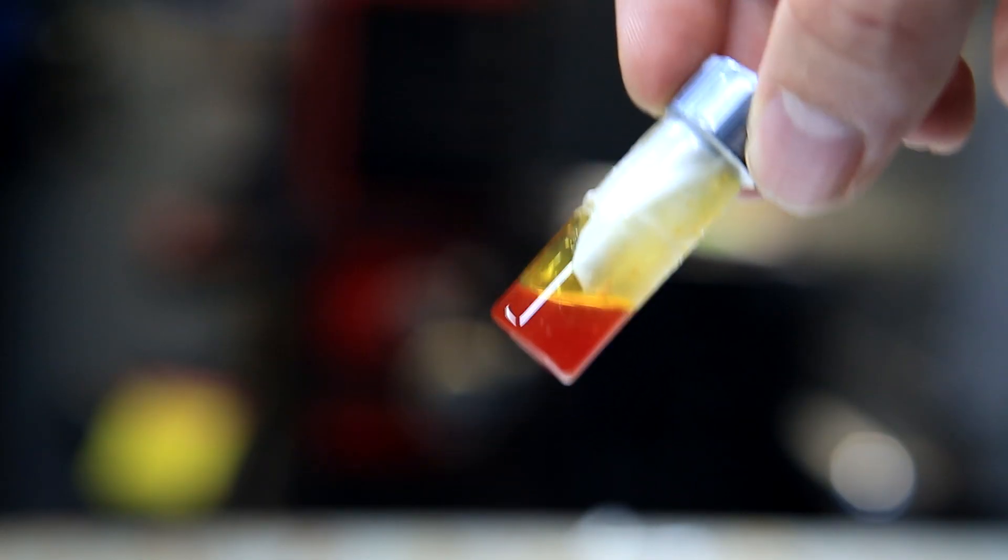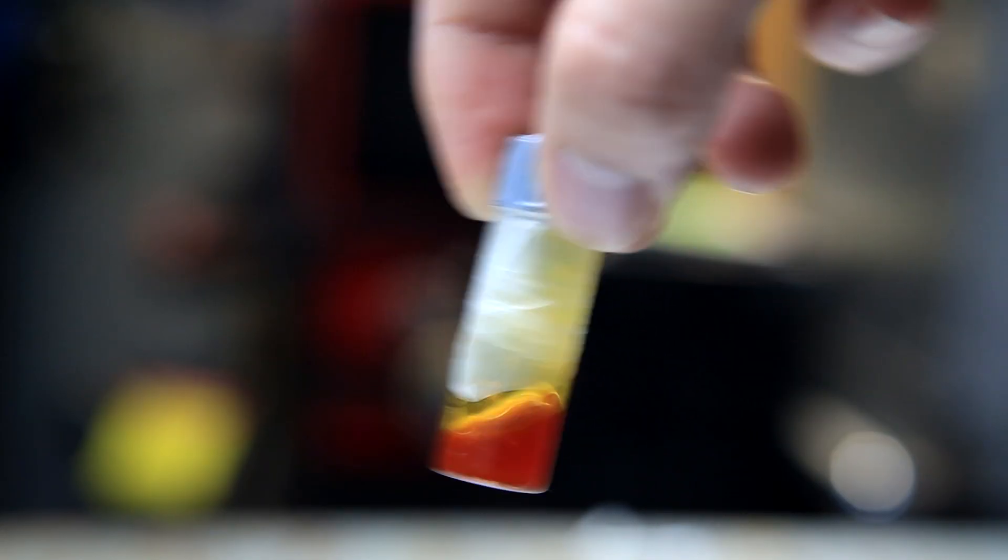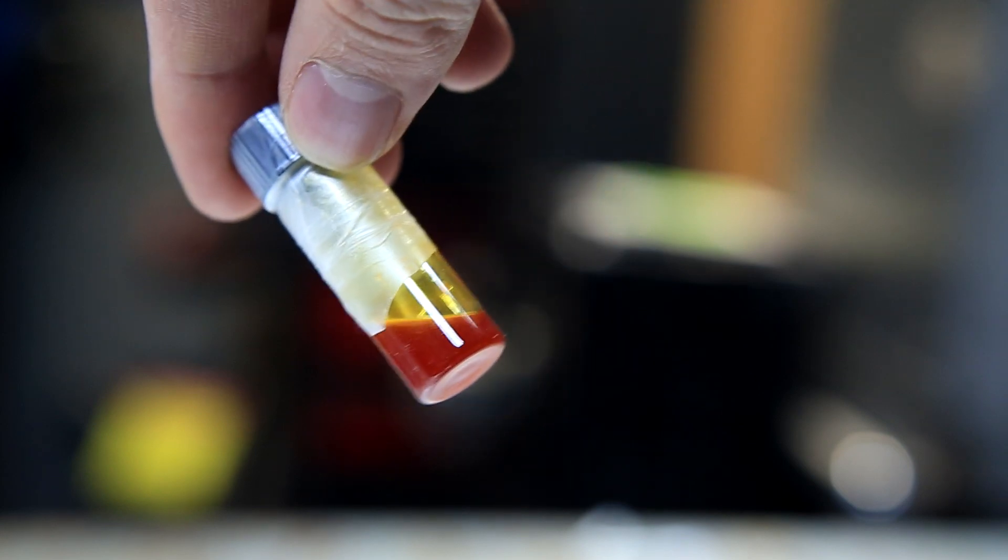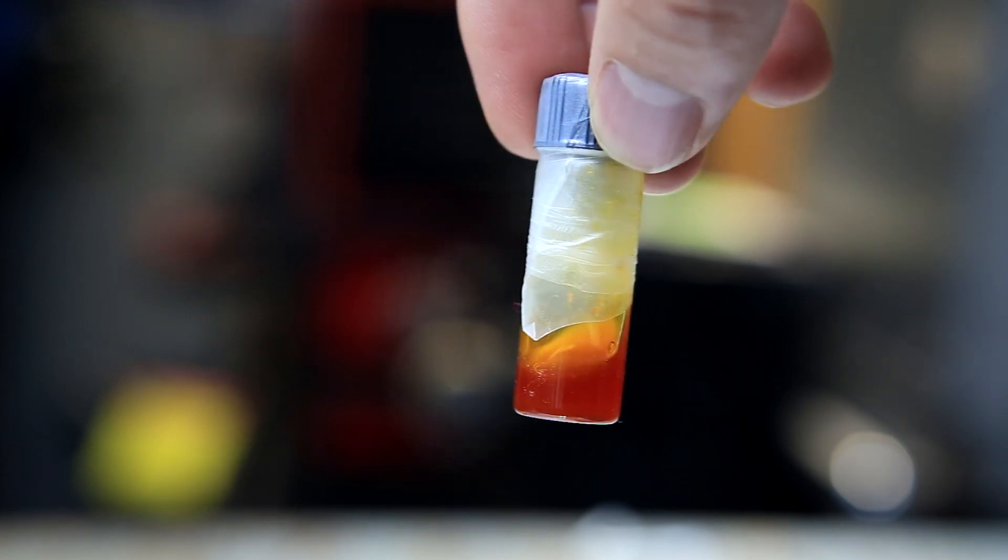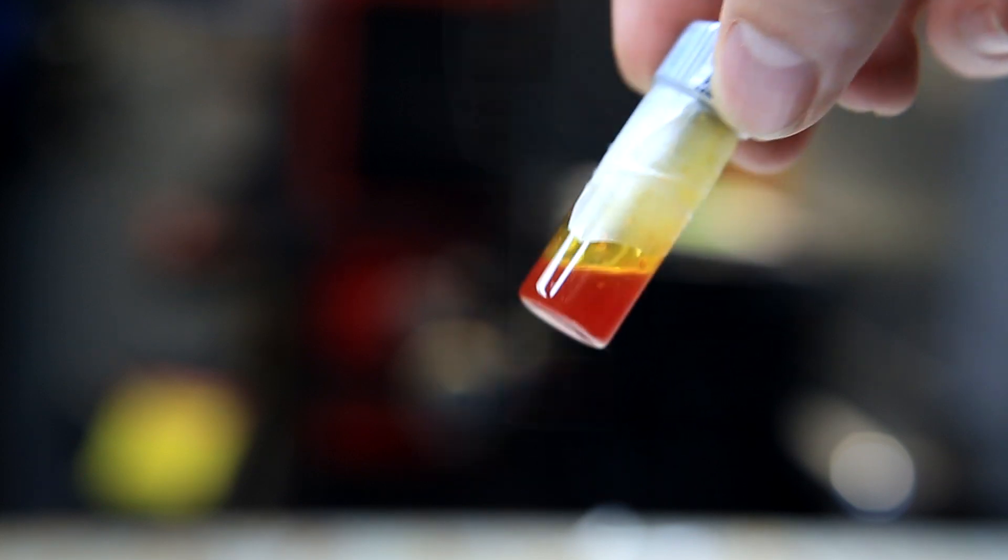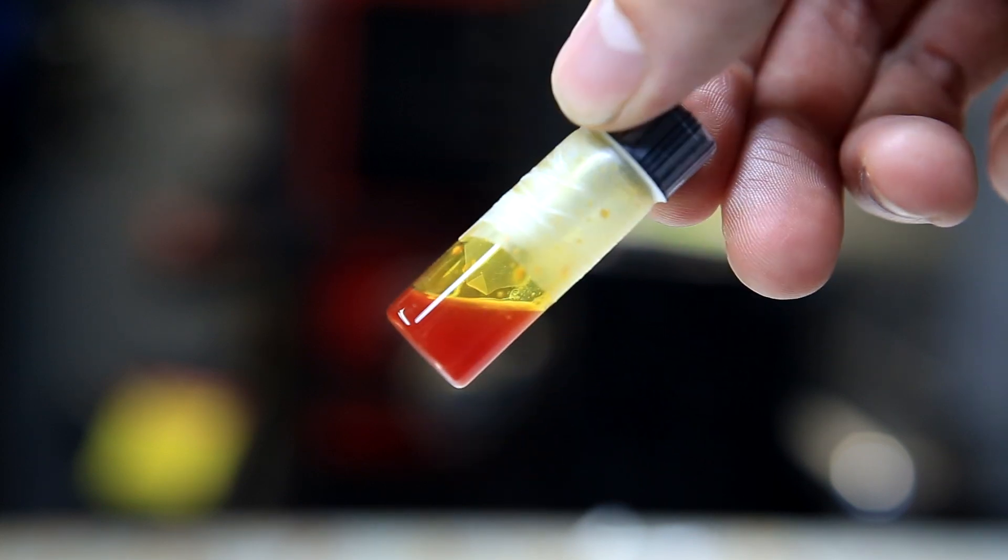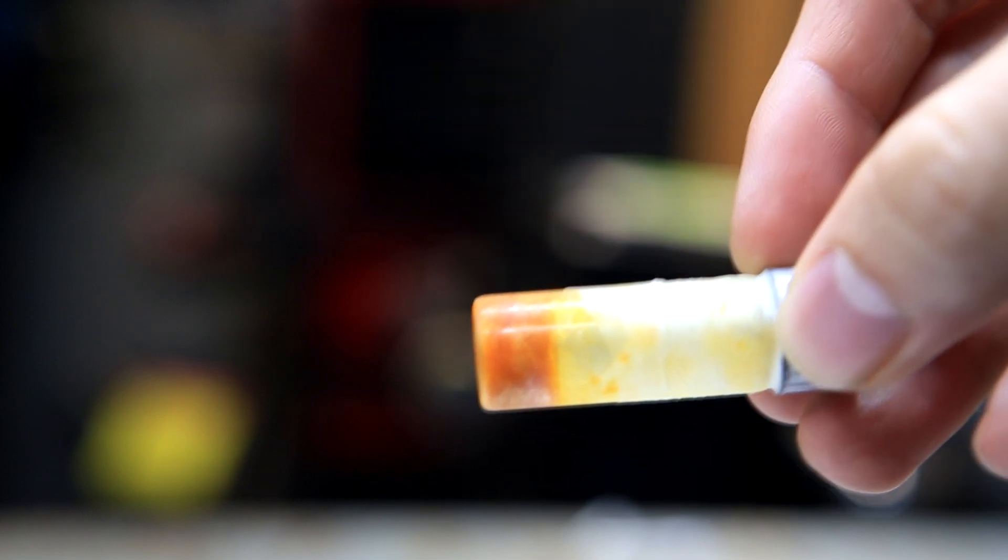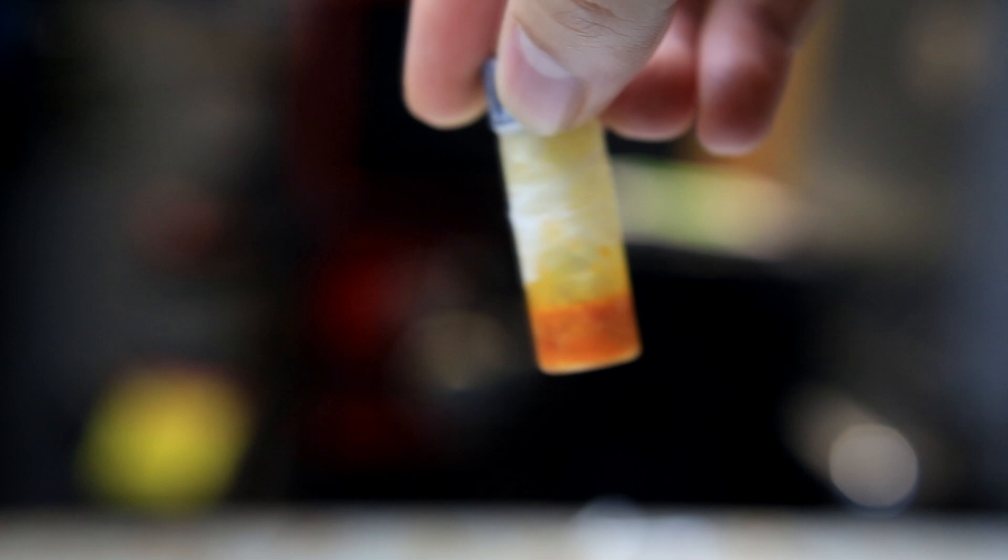So, in the end, we were left with a measly one gram of phenylhydrazine freebase. Normally, phenylhydrazine freebase is faintly yellow to colorless, but when exposed to air, it slowly takes on a red color. It has a melting point of around 20 degrees Celsius, so when it's put in the freezer, it should solidify like this.